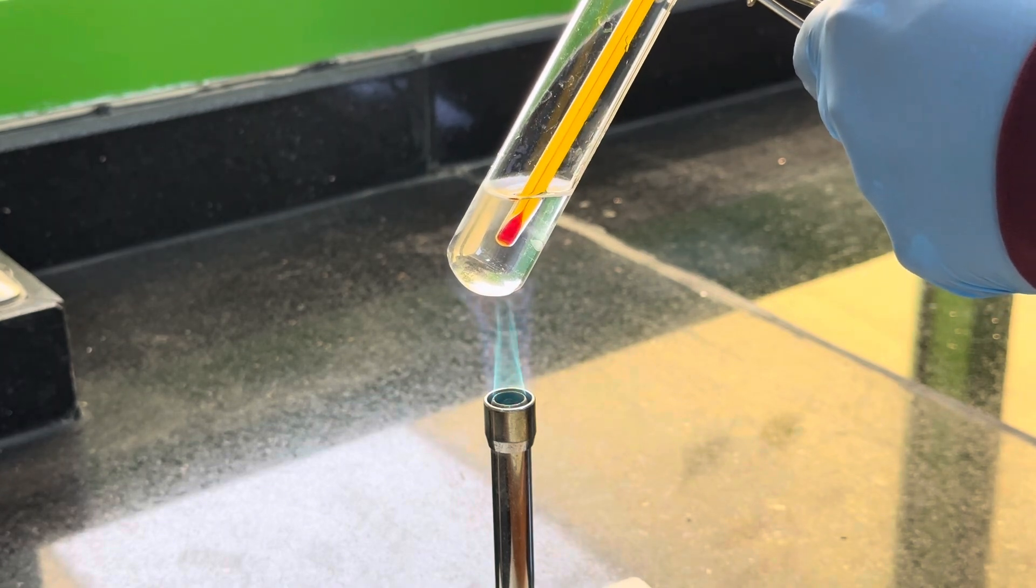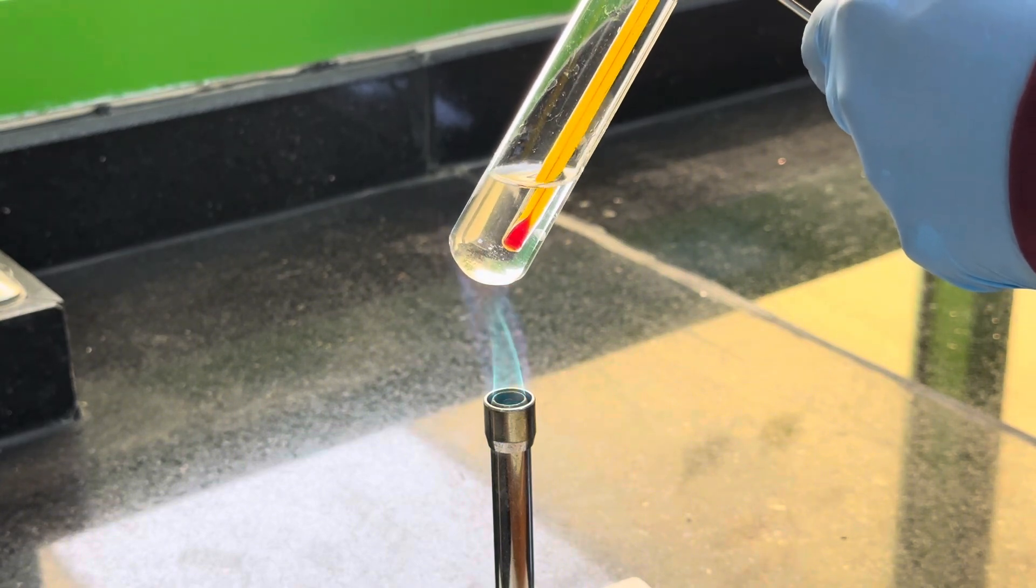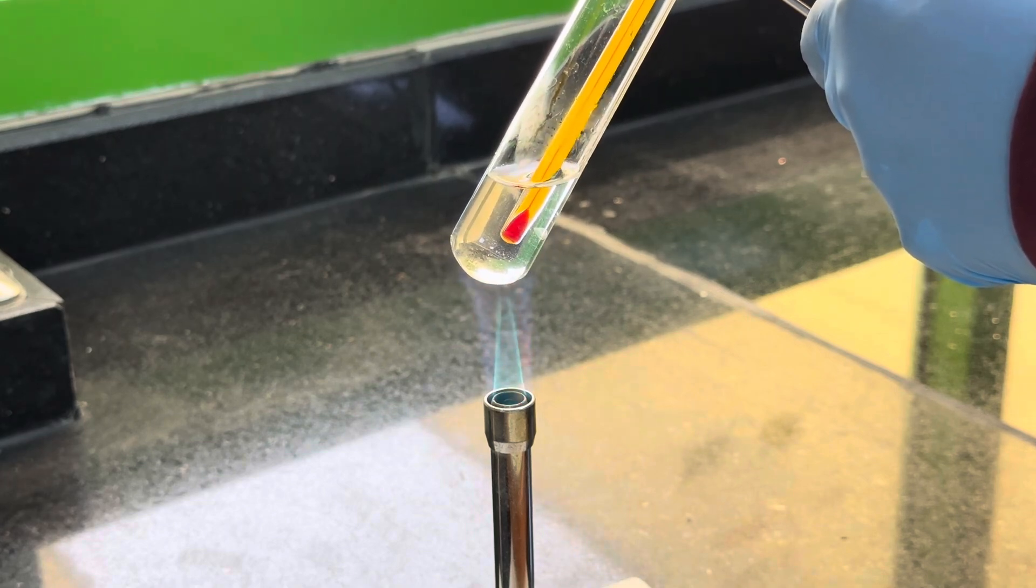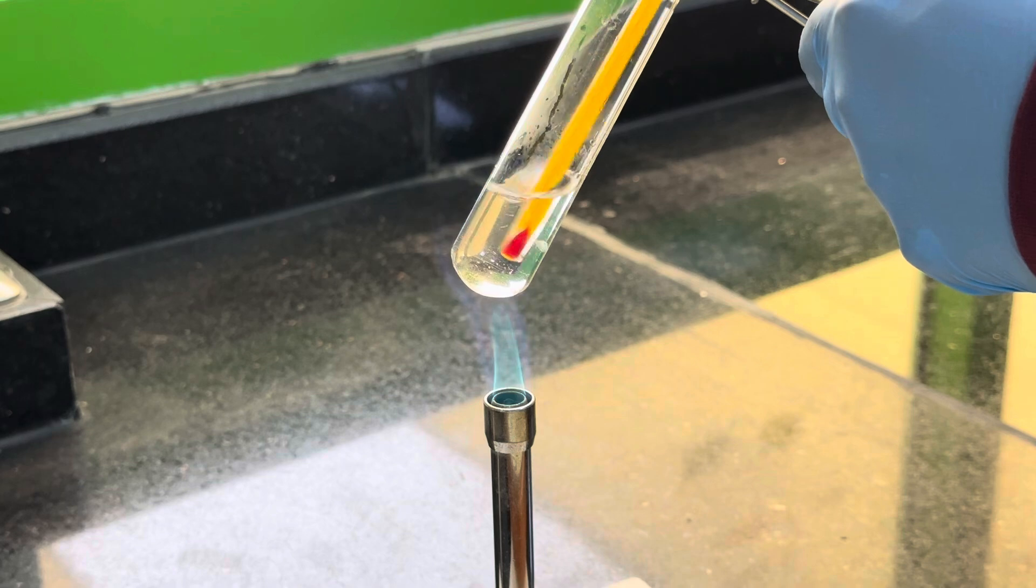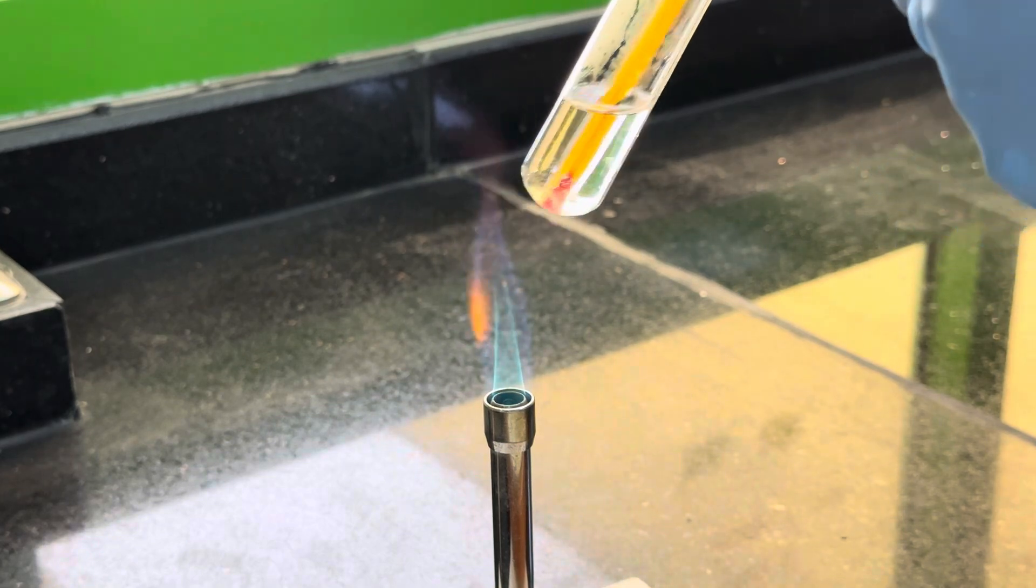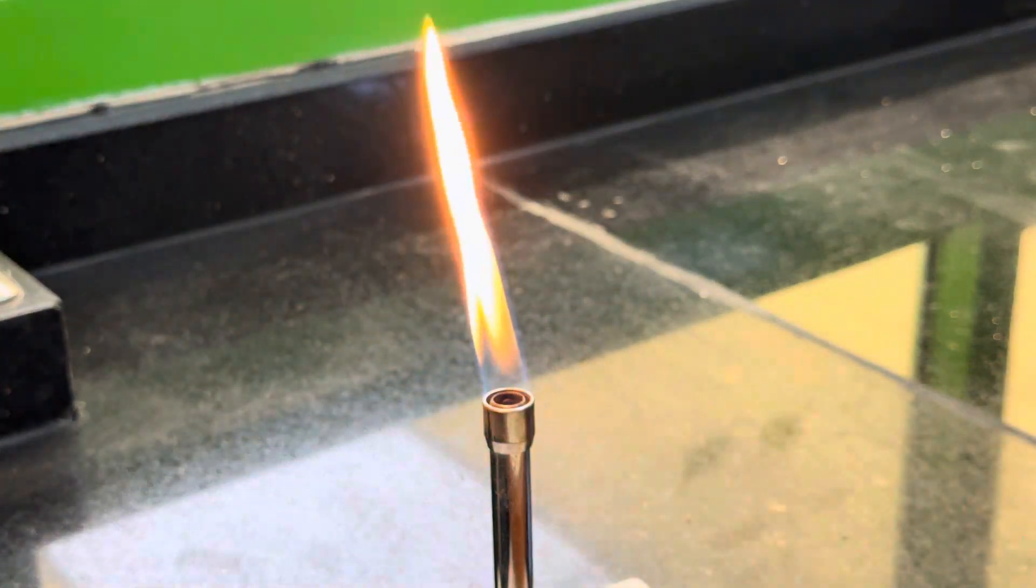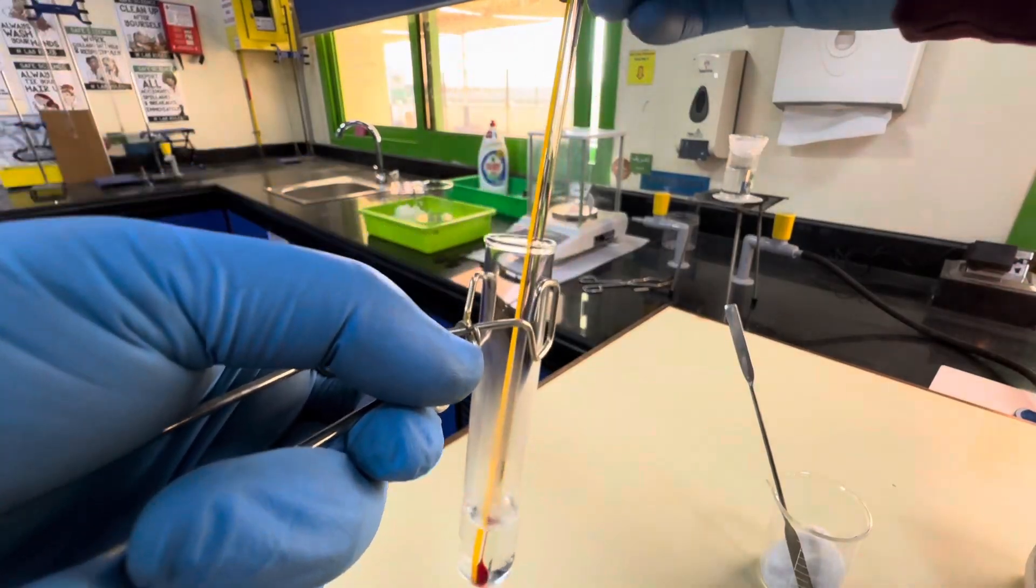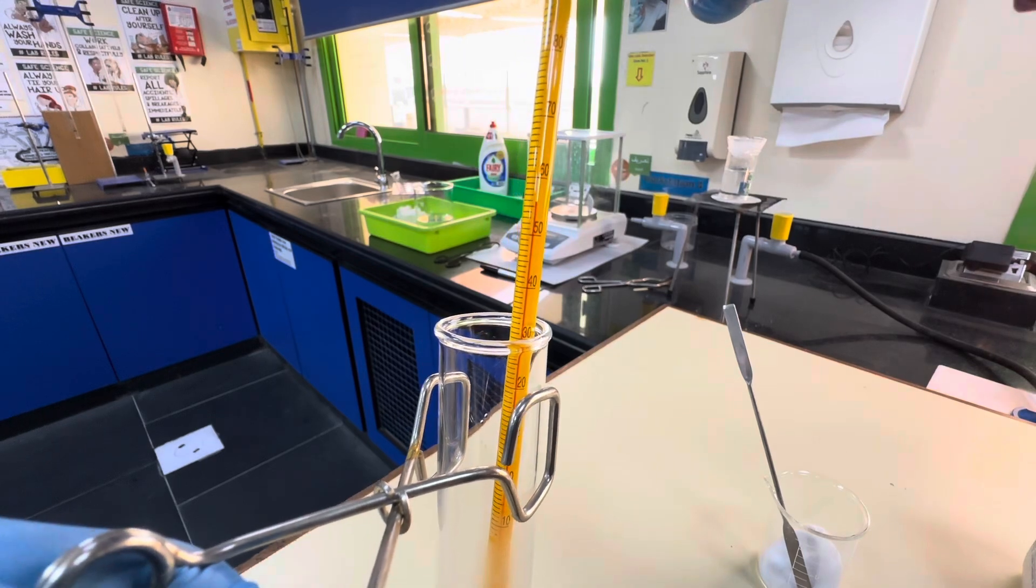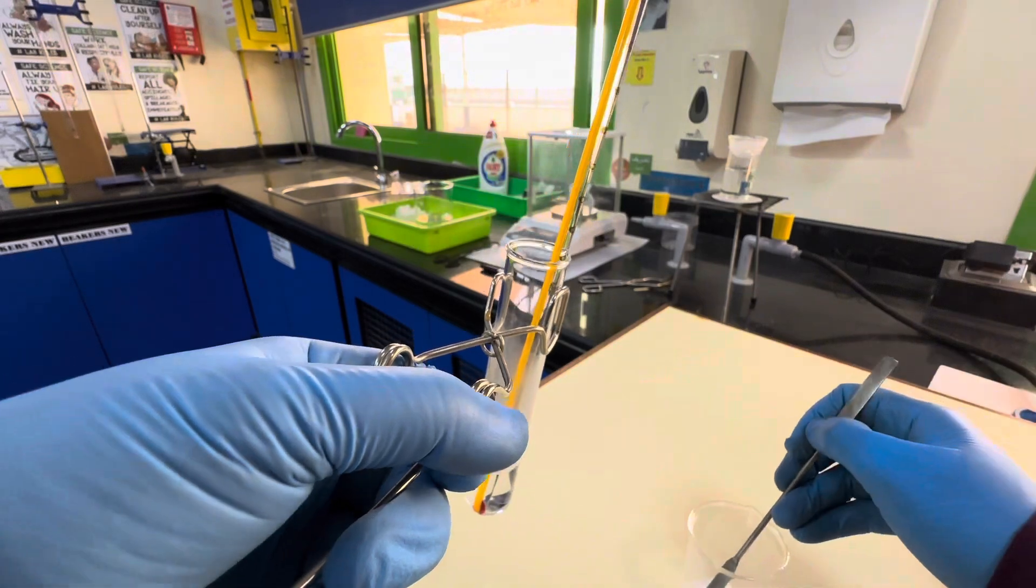At the moment it's rising quite quickly, it's around about 25 now. 30 degrees celsius. This boiling tube rises pretty rapidly to 40 and now when it's hit 45 I'm going to take it off the heat. So now it's roughly 55 degrees and what I'm now going to do is I'm going to add the potassium nitrate.